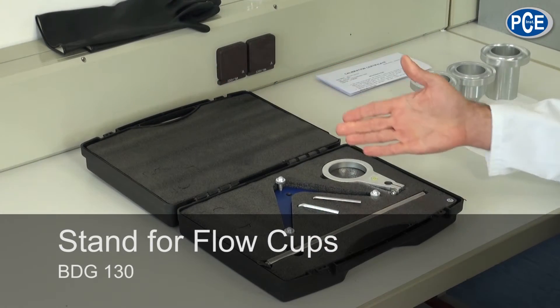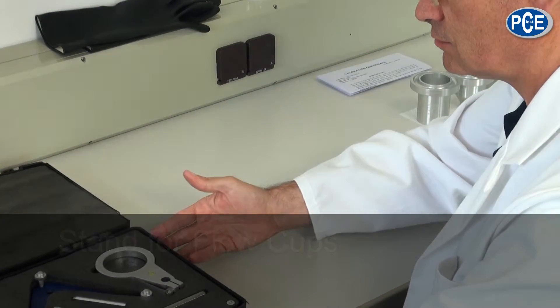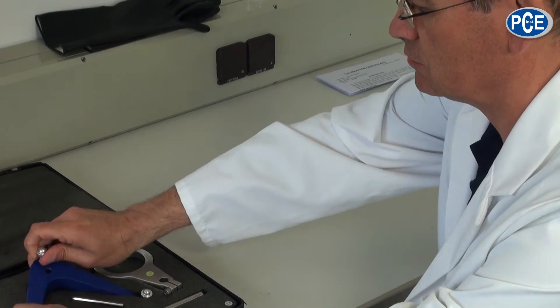The stand is delivered in a practical hard case. To build the stand up, first of all the base of the stand is taken.